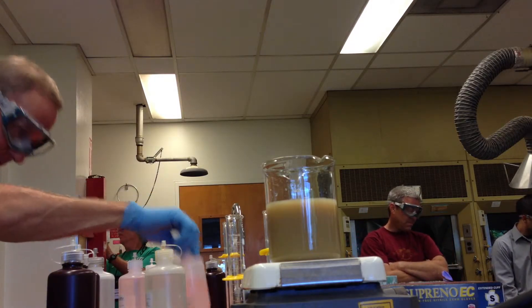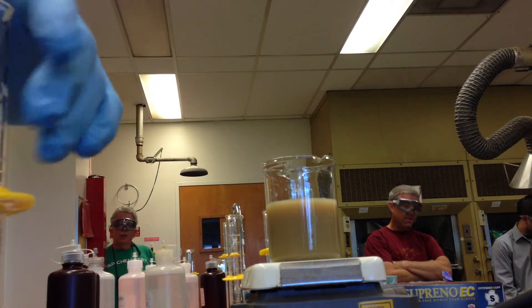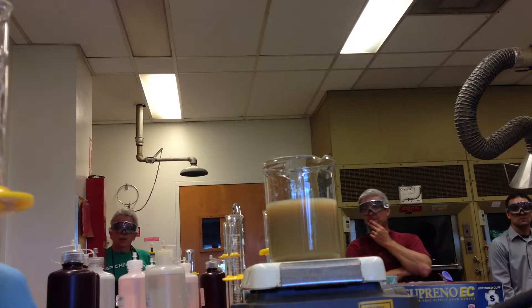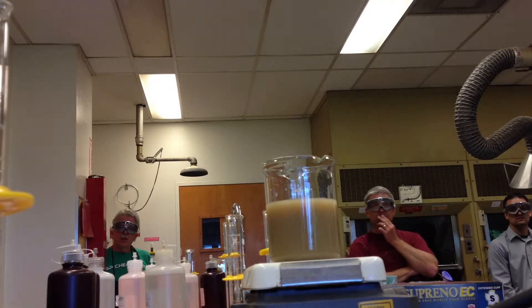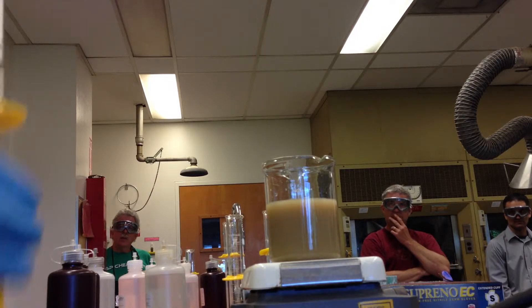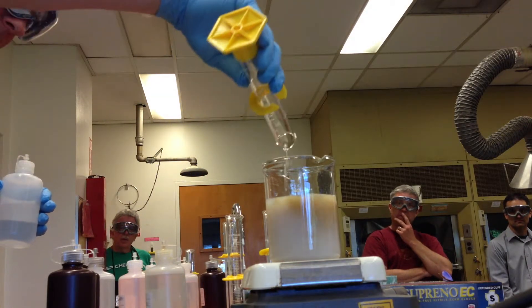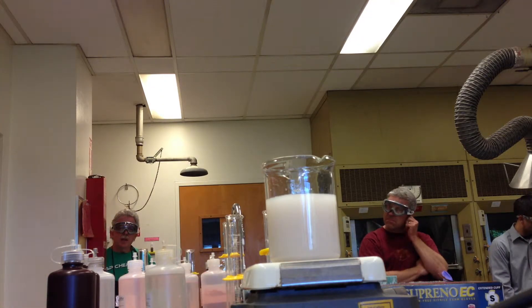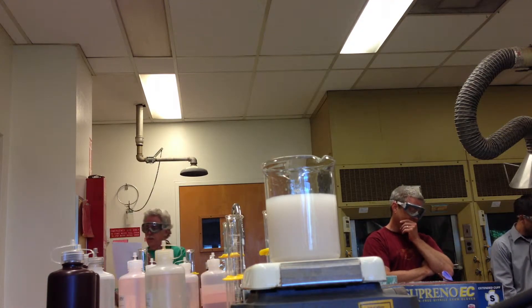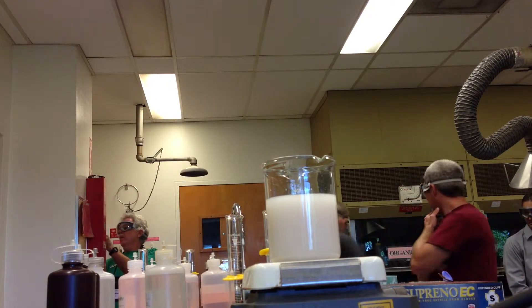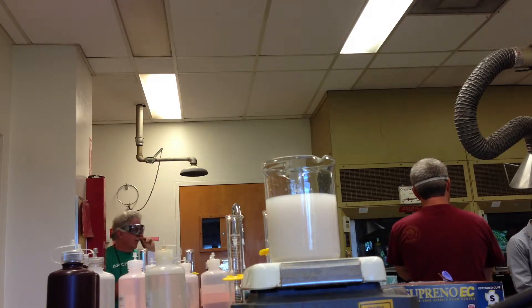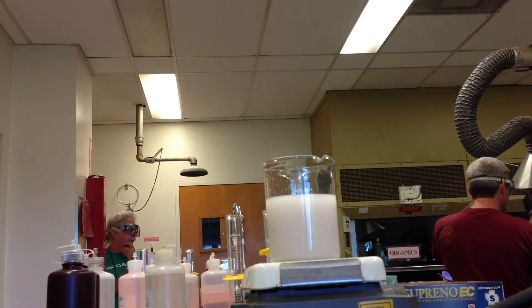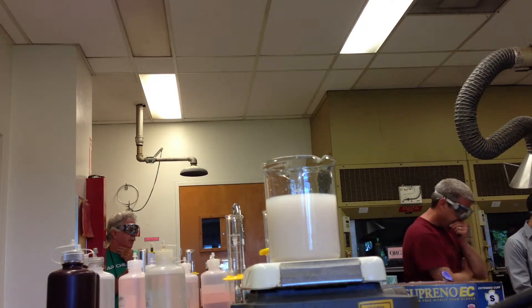Sodium chloride is next. What do we get with sodium chloride? Silver chloride. Which color is silver chloride? White. 30 milliliters of sodium chloride. They're clear signs. That student is like I'm stuck. I'm like, come here, smell this. It hurt.